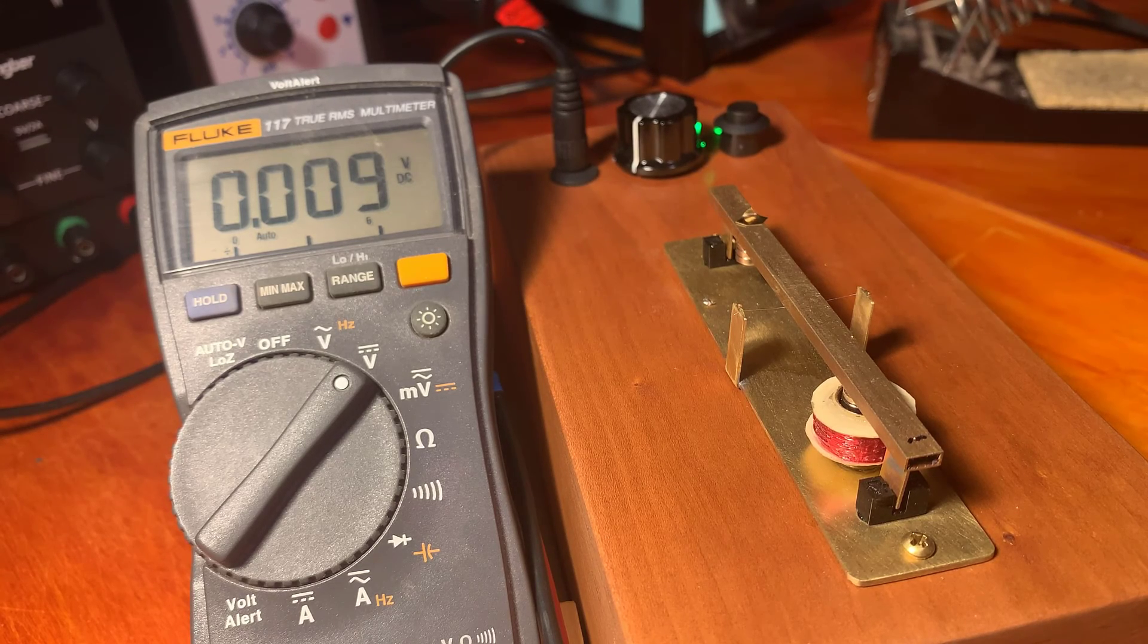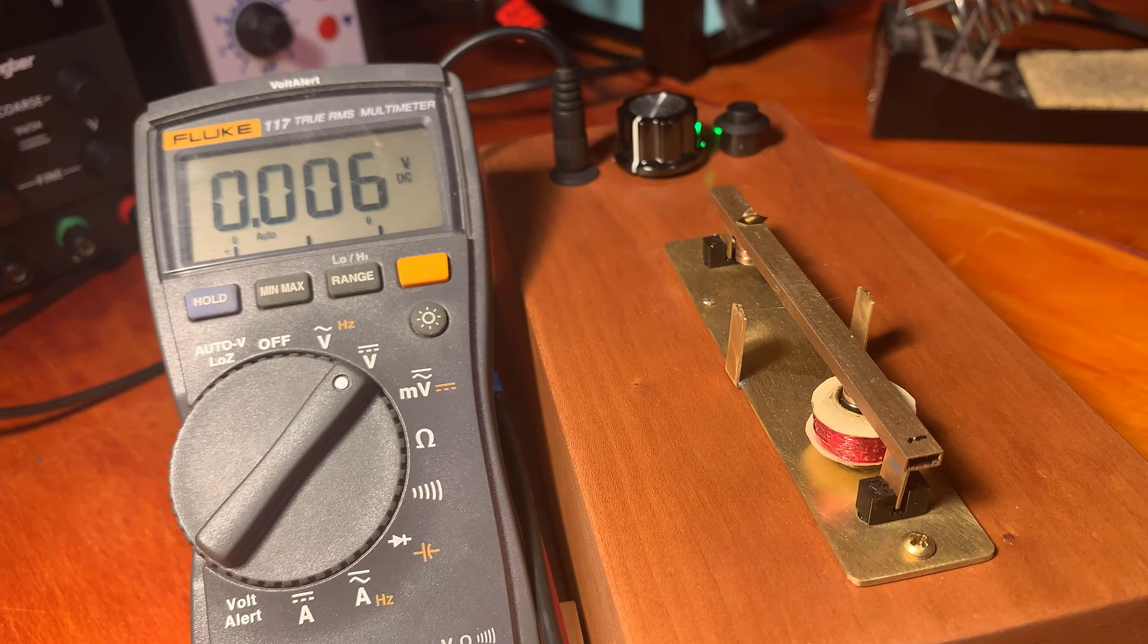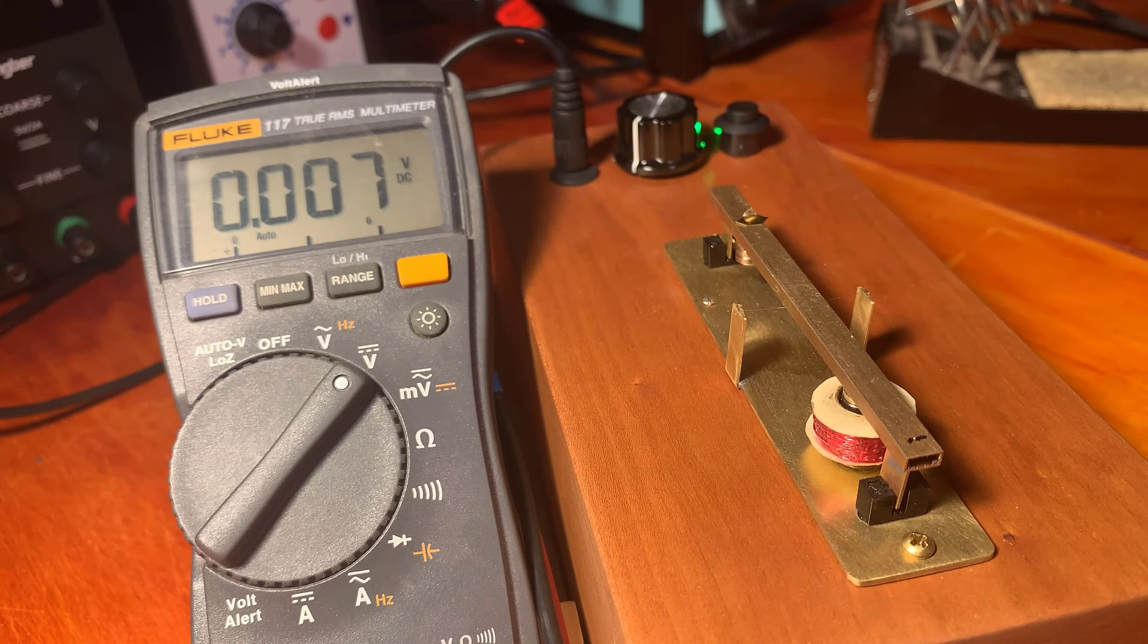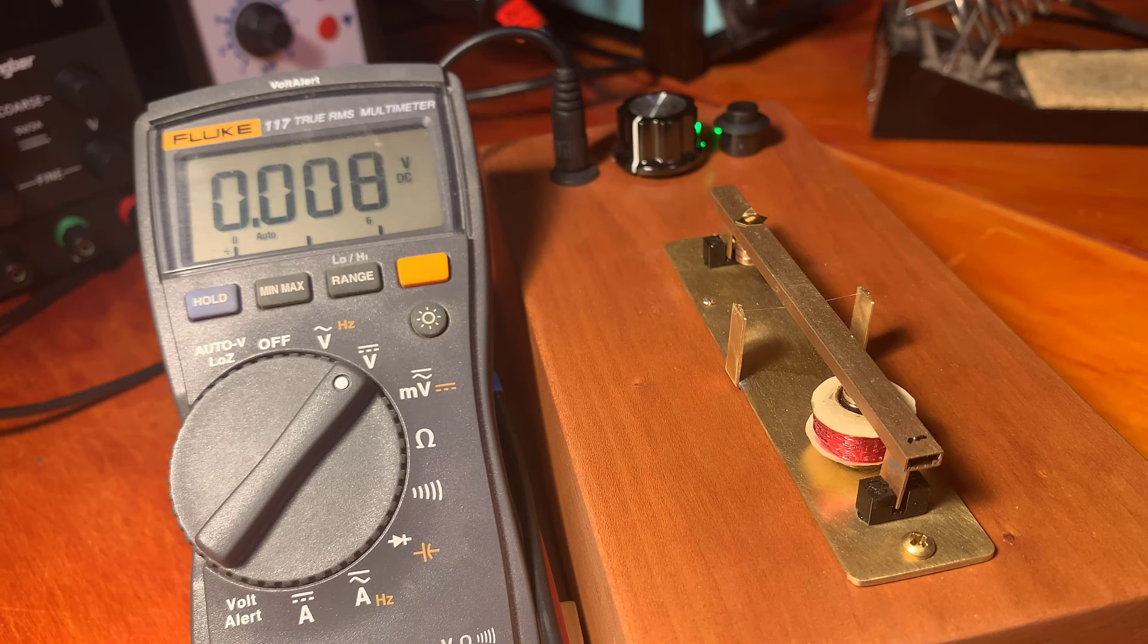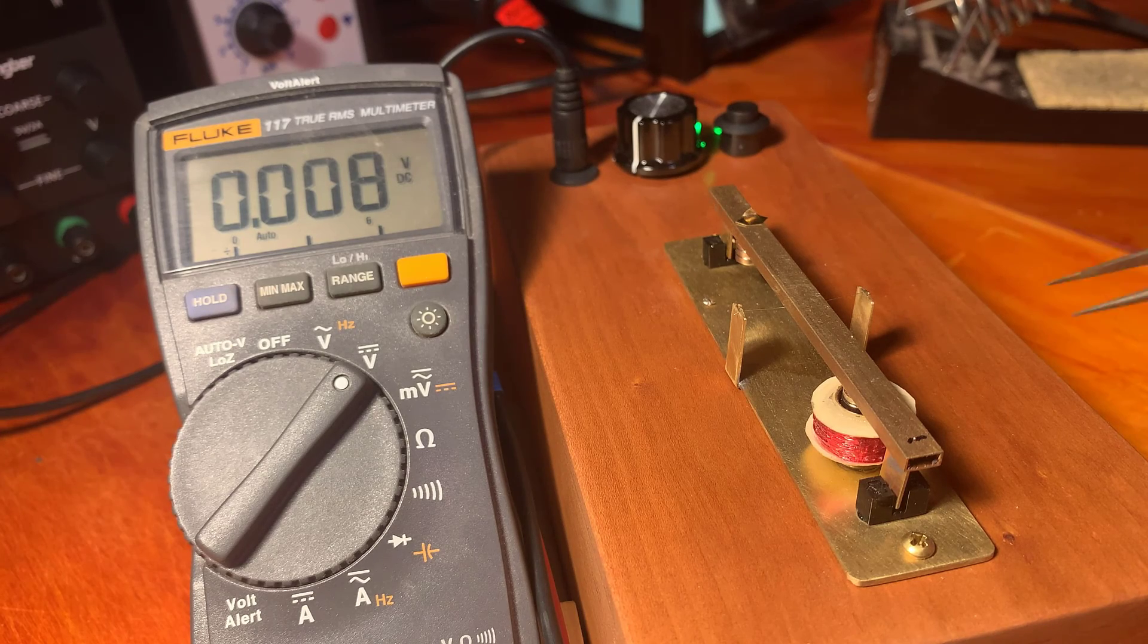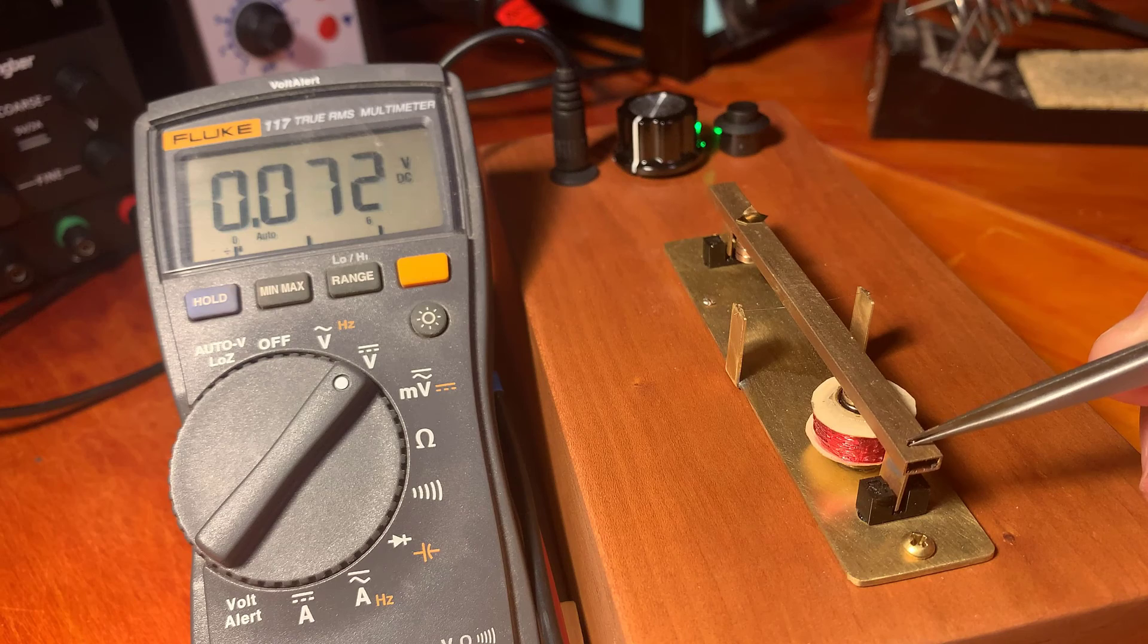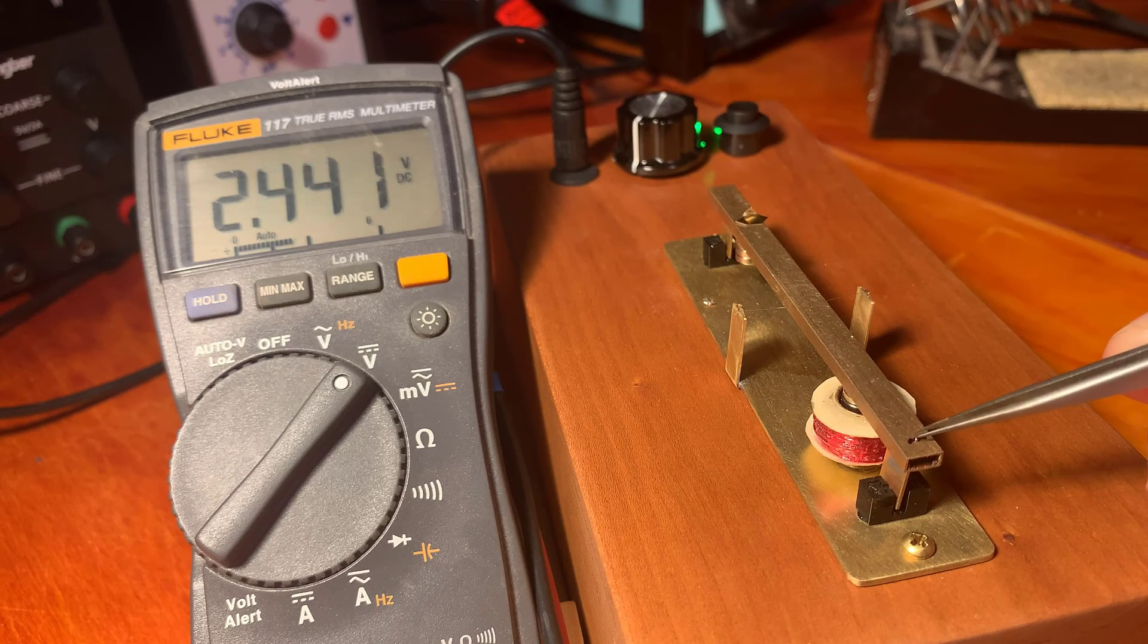So it's an insubstantial amount. I started with 100 grams of ore. That's an insubstantial amount of gold in the ore. That would correspond to about 1.6 parts per million. And some of that is silver. You can see it's not a very gold colored bead.